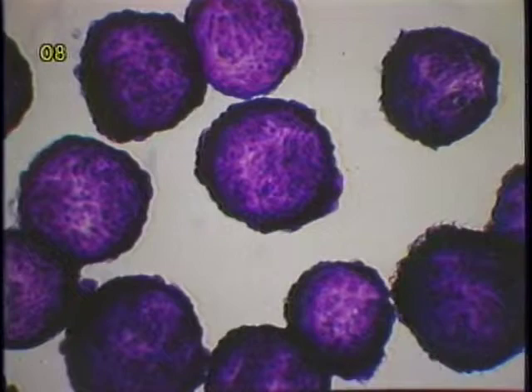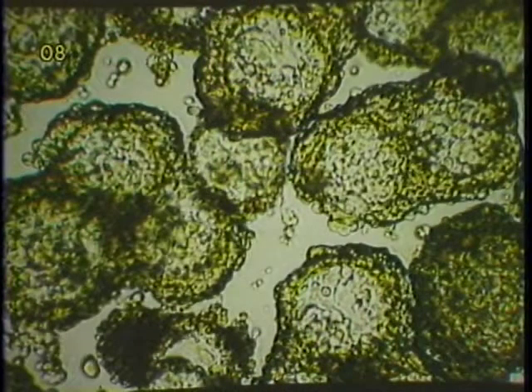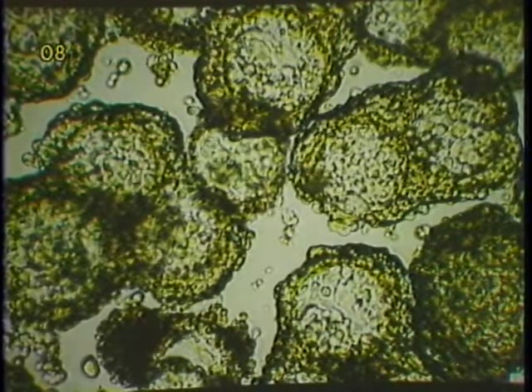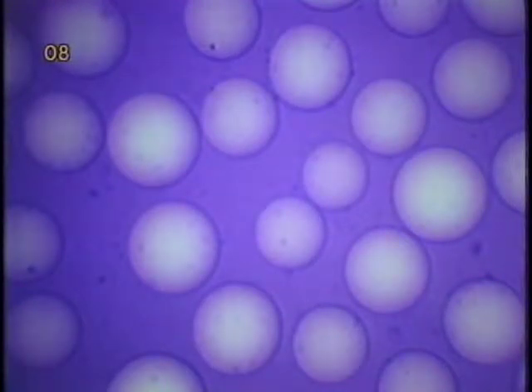In other cases, cells on microcarriers may have formed multi-layers or even clumps. This usually causes difficulty in releasing all of the nuclei from microcarriers. Therefore, it is important to observe microcarrier and nuclei suspension under a microscope after the shearing step.